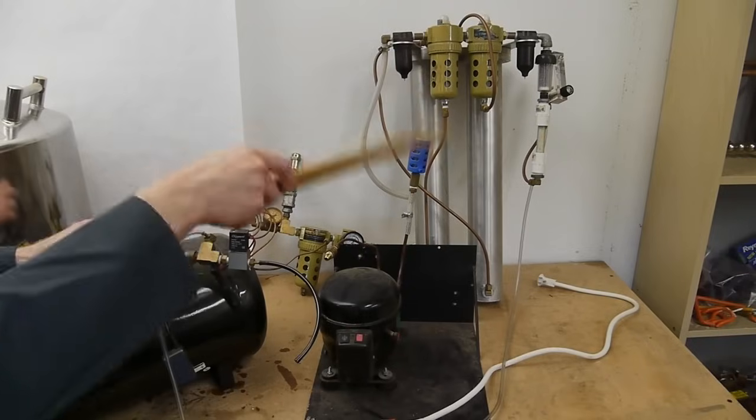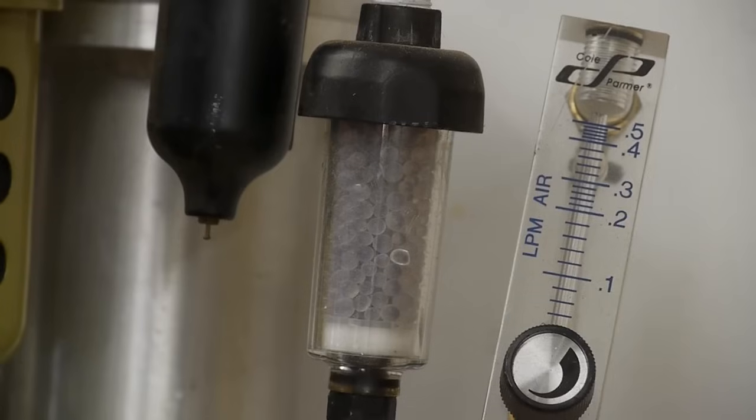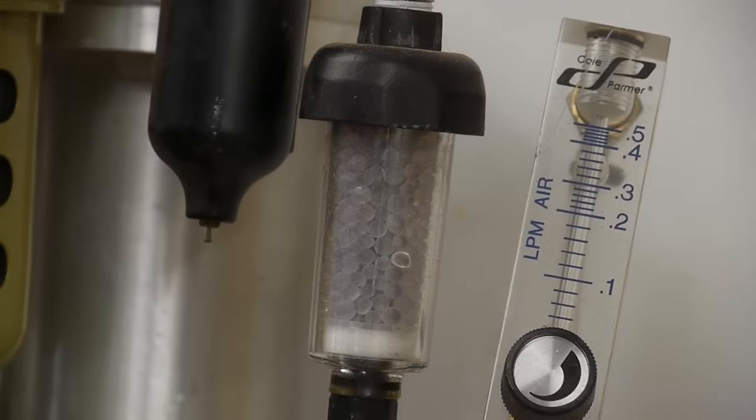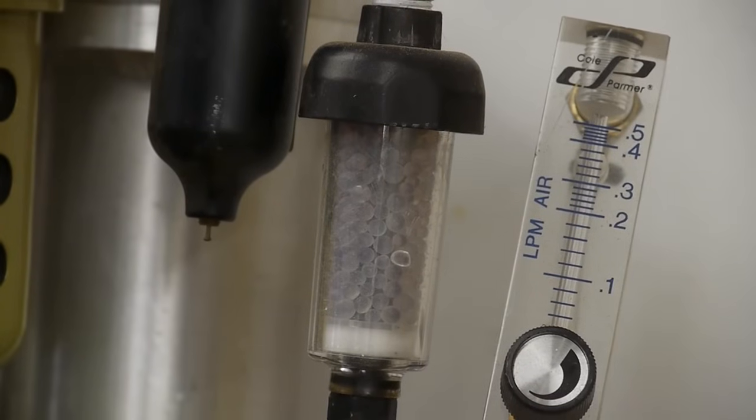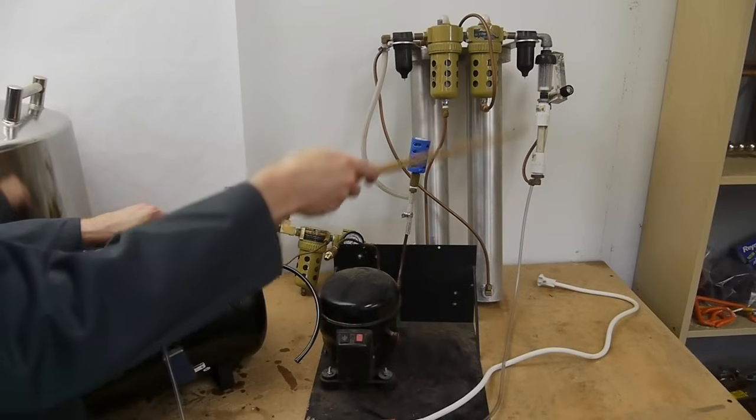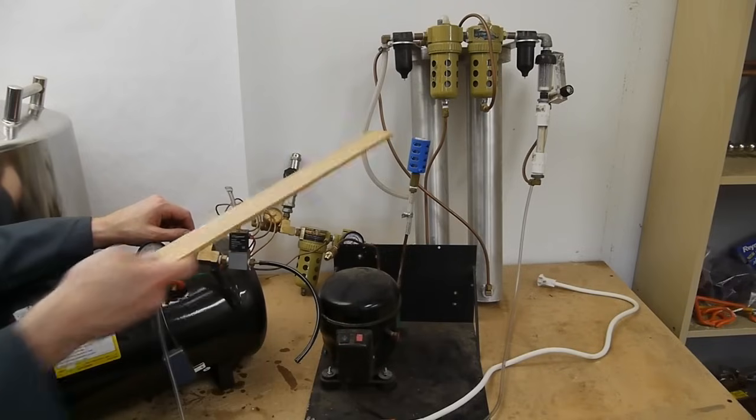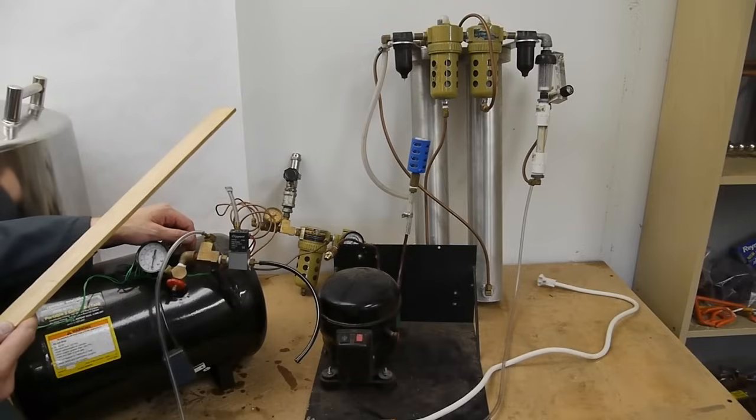After going through this convoluted path of filters we go through an indicator glass so this has silica gel with an indicator that turns pink when it's exhausted and as you can see it's completely pink now because this thing has been sitting on the shelf for a while. This would let me know if I needed to open this up and recharge the silica gel that's inside there and you can recharge it just by putting it in the oven to drive off the moisture and it acts like a moisture sponge.